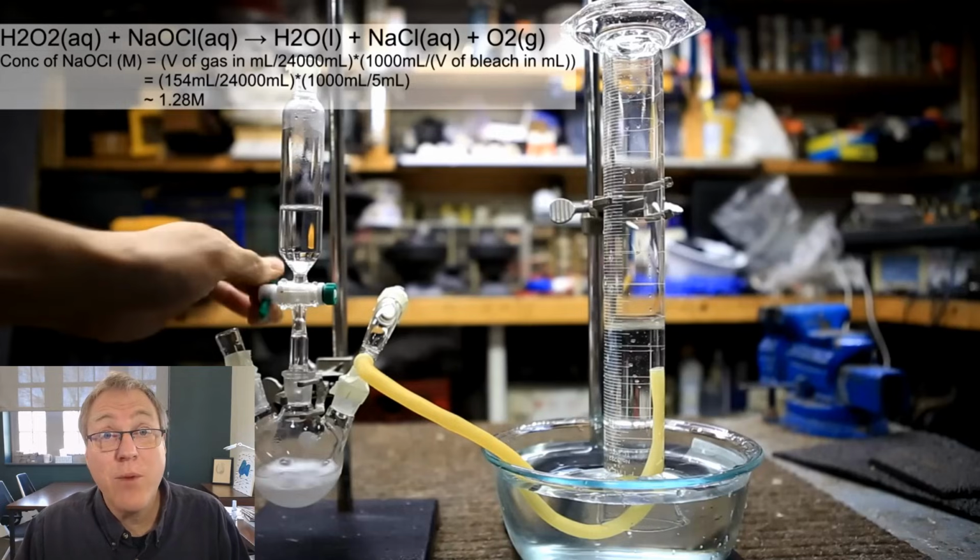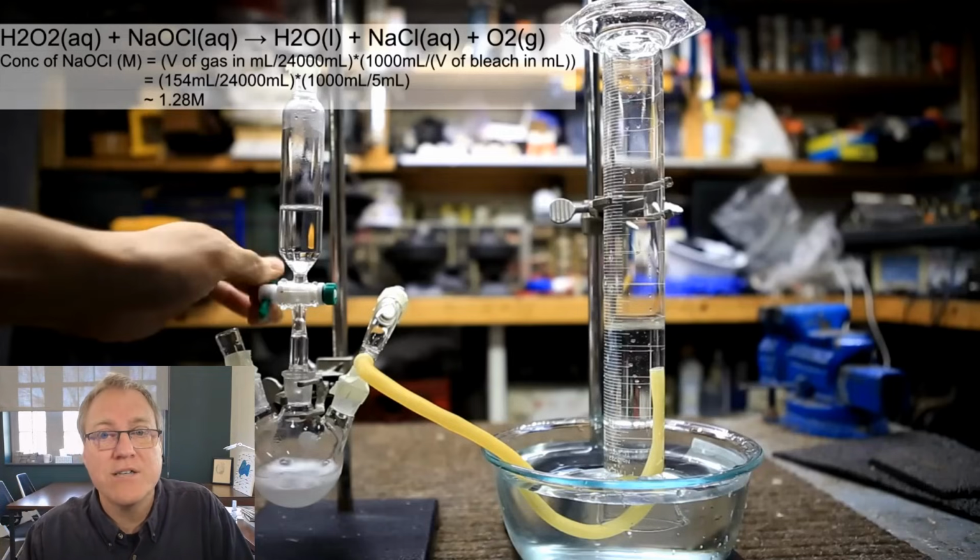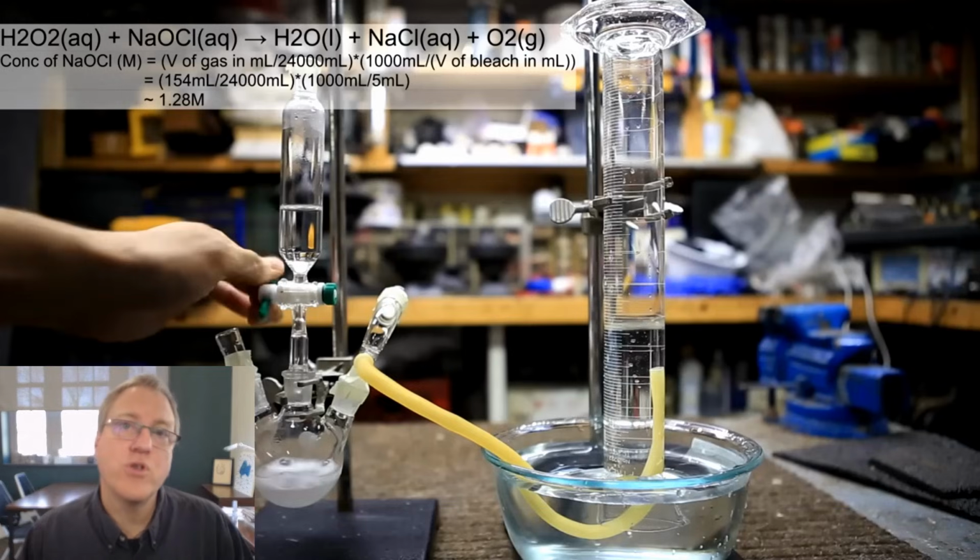I am impressed with how much gas was released. I thought it'd be a small volume change. That's a lot, from just 5 milliliters of bleach. That's impressive. So as you can see, he calculates a concentration of about 1.28 molar of sodium hypochlorite.